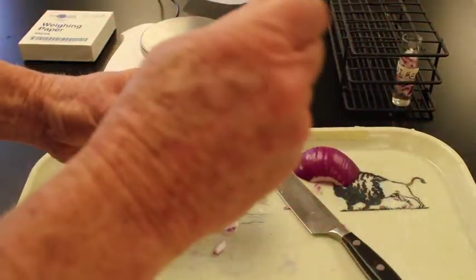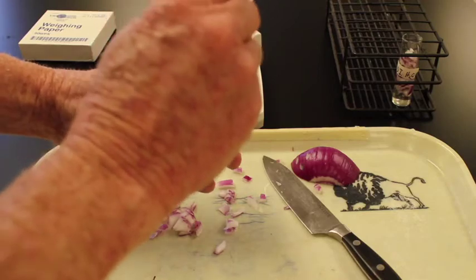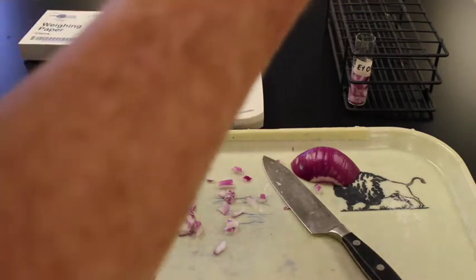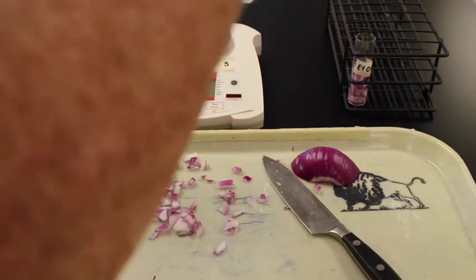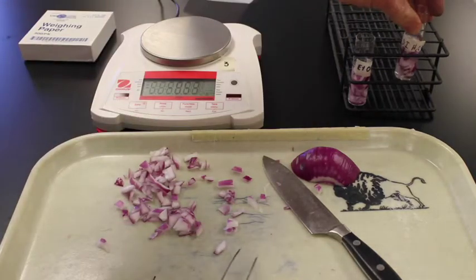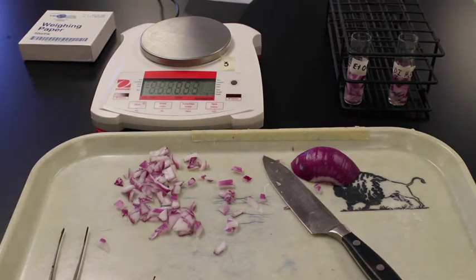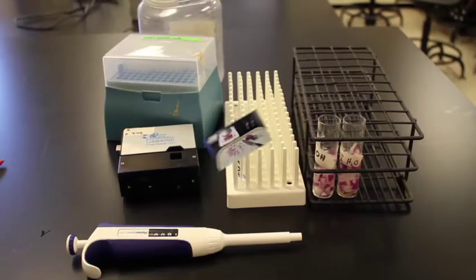Now you'll notice that the tissue in both of those is down at the bottom, so I need to take this, push it down, make sure that all of those tissues are below the surface of the solution. Take this, push it down, make sure that everything is below the surface of the solution so that we have them ready to go. And in 30 minutes then we're going to take those out and do the next step.